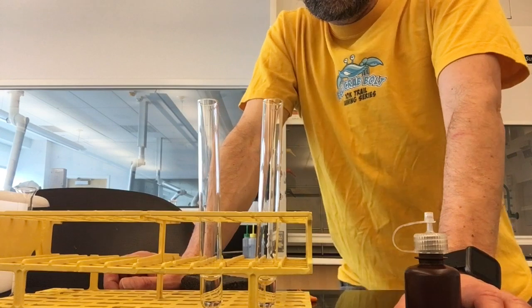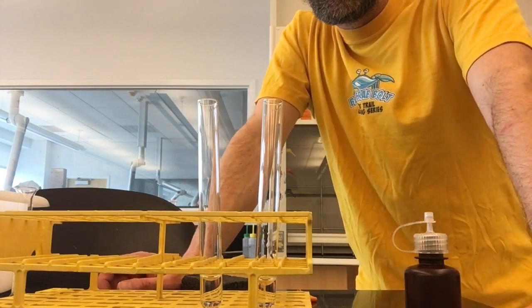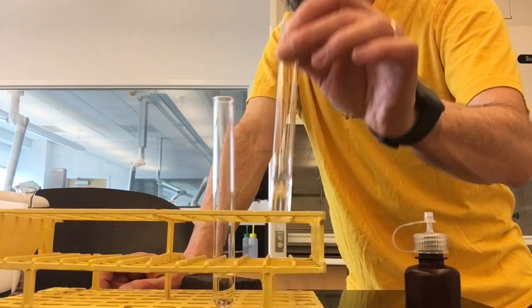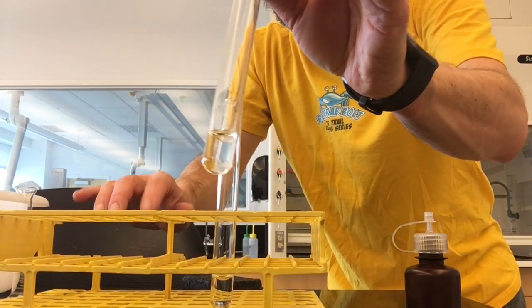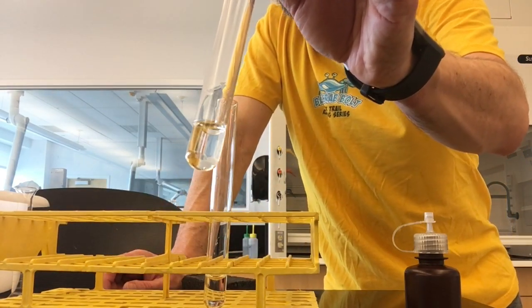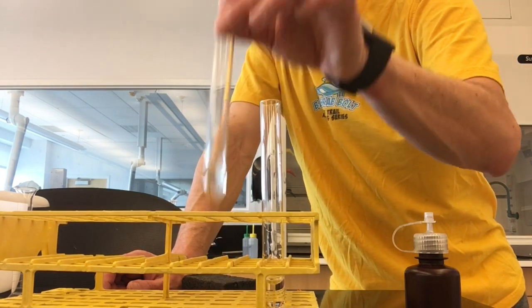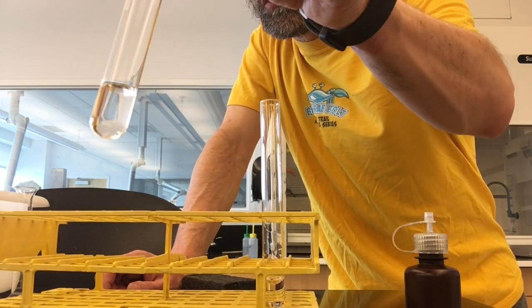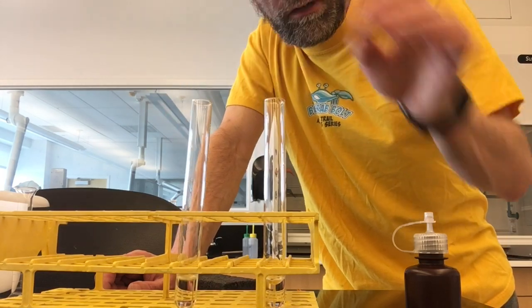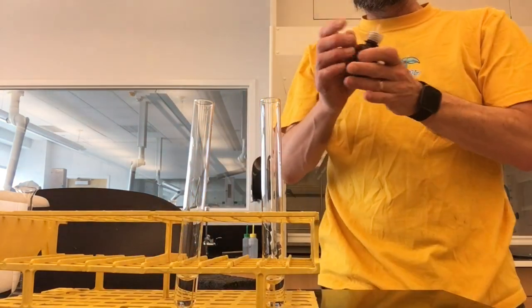I'm going to do the same thing again. I have two test tubes, both with two milliliters of water. The first one has five drops of bromoethane, a primary bromide. The second one has five drops of 2-bromopropane, a secondary bromide. I'm going to add five drops of silver nitrate to each.